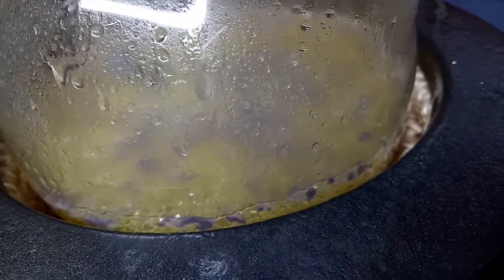So temperature control is a little bit of an issue here. Now this little shot, you can see a little bit of the yellow oil appearing. I was really excited when I saw that. I thought, yay, that's where my product is going to be.